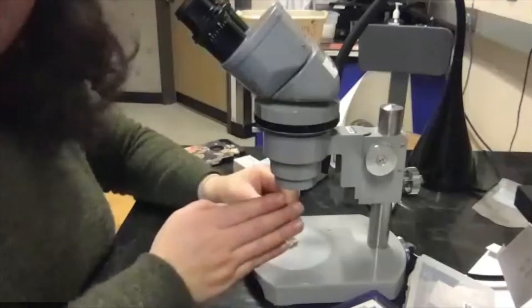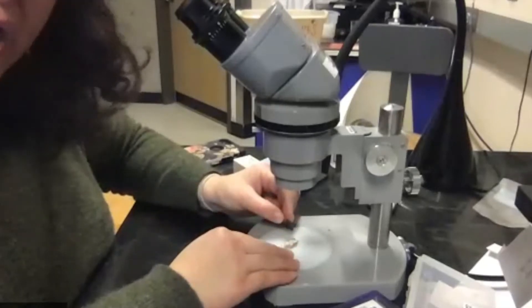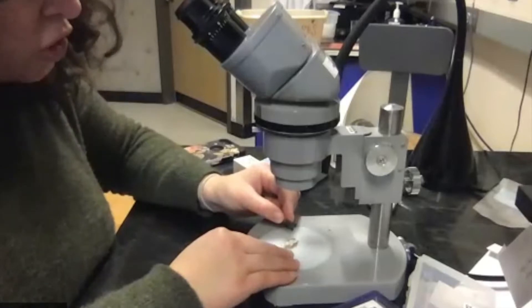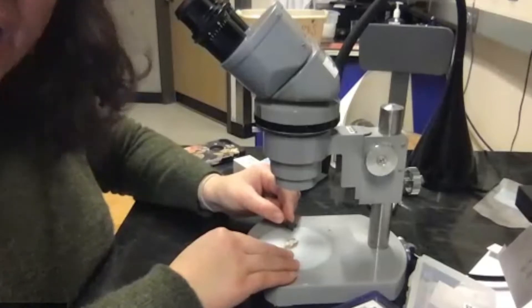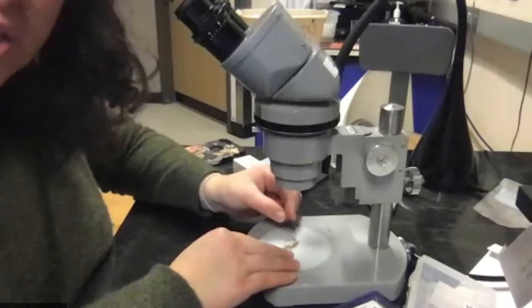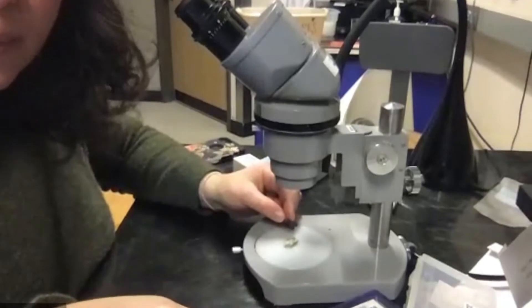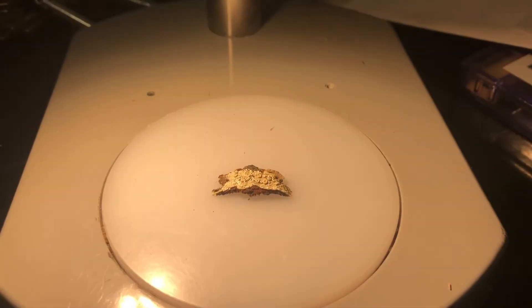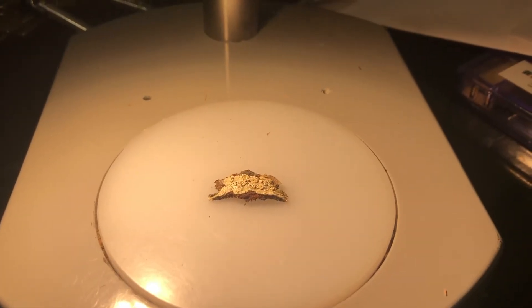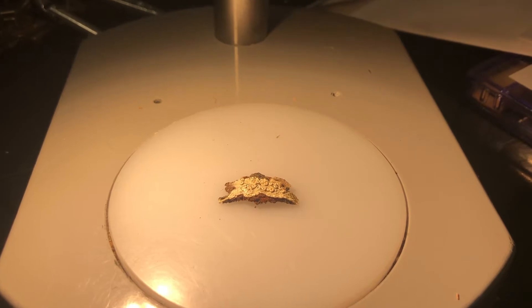If you don't have a dissecting microscope, you're going to want to find a nice surface to cut on. Now I'm going to show you how to prepare the slide ahead of time so you can easily transfer the tiny sections into droplets of water on a slide. Today we're going to learn how to properly cross-section a crustose lichen apothecia for visualizing the spores for crustose lichen identification.